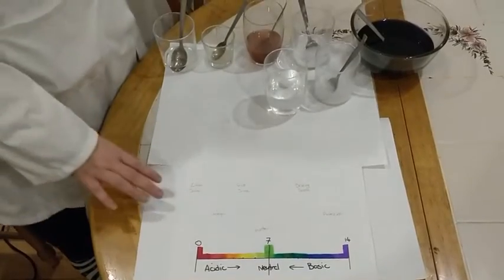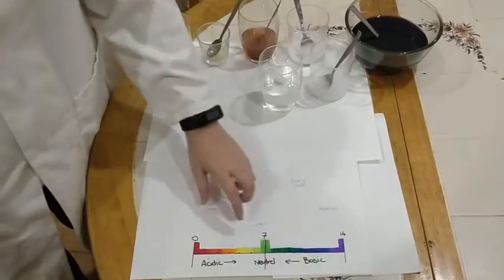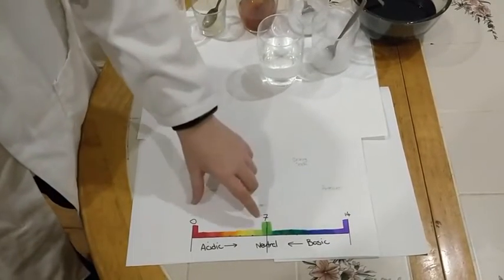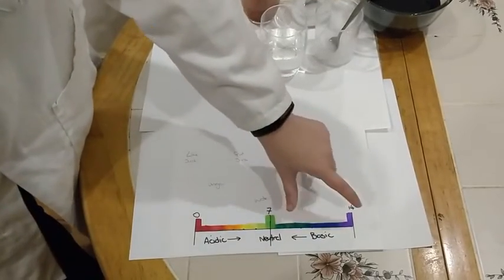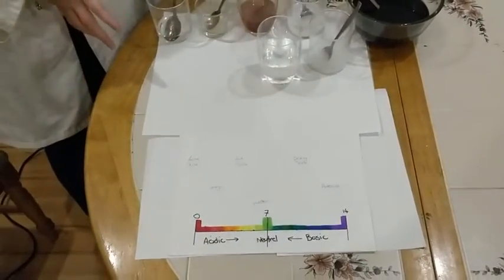As we were talking about in class, we were talking about the pH scale. From the notes, this pH scale is a colour gradient scale. We start at this end with 0, which would be a red colour, and then we move up the pH scale to pH 7, which would be neutral or green, and then we move up to the basic end, which would be purple. It is important to note that these colour changes are what we are going to see when we test these chemicals.